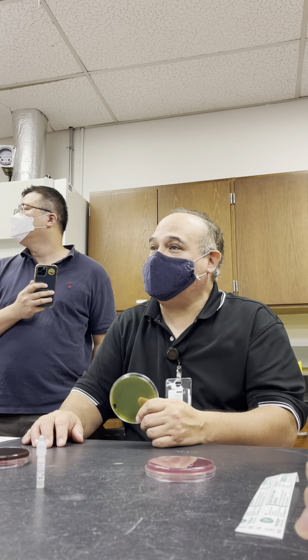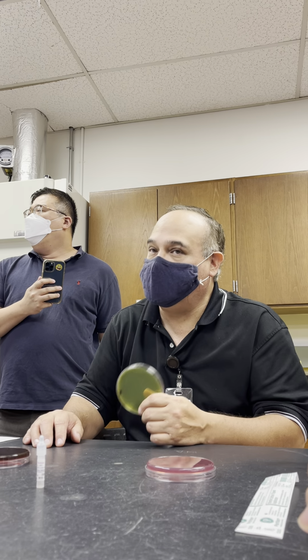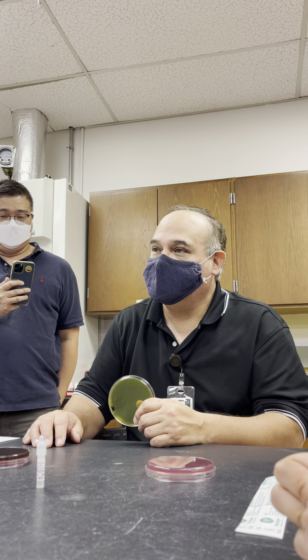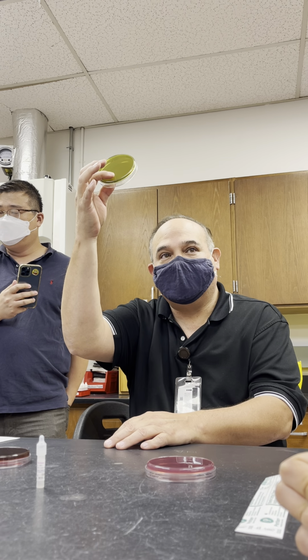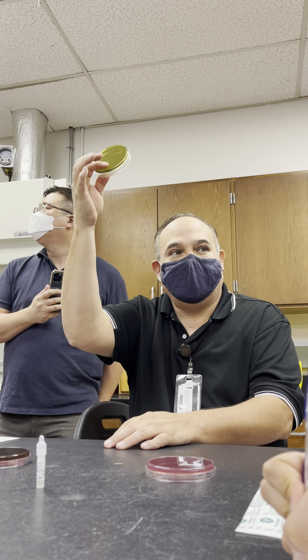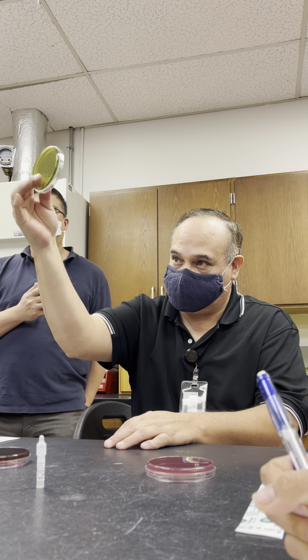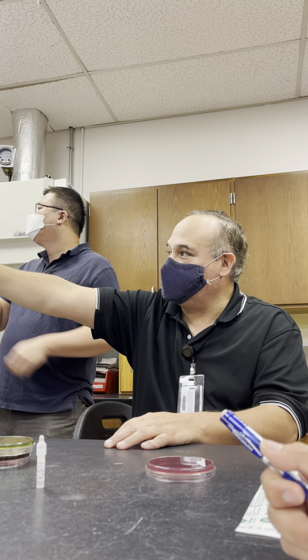And if you have a lactose non-fermenter that's H2S positive, then it's what? Salmonella, potentially, right? Good? Everybody with me? What's the application for Hektoen enteric? To test what? What are you going to test? For pathogens. You're going to test stools. It's right there. See it? Used to test stools.